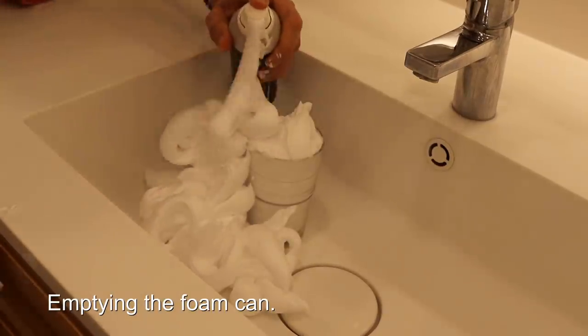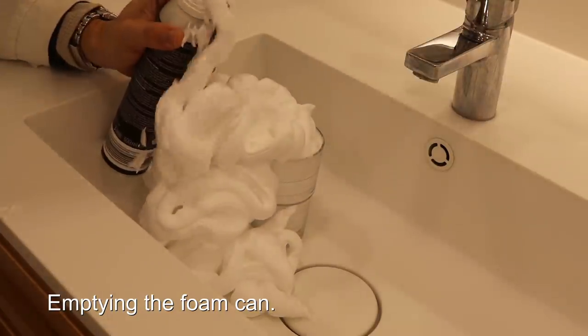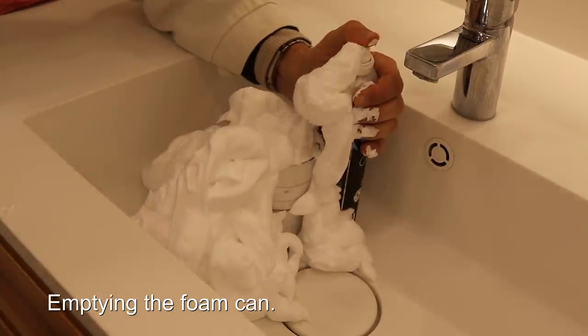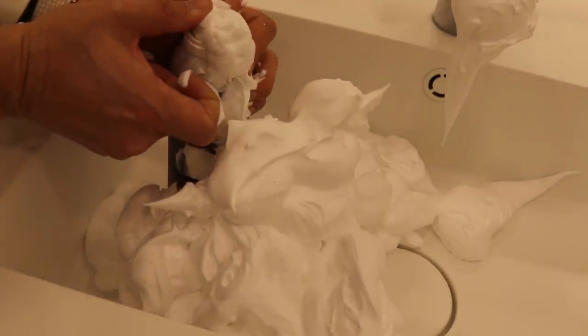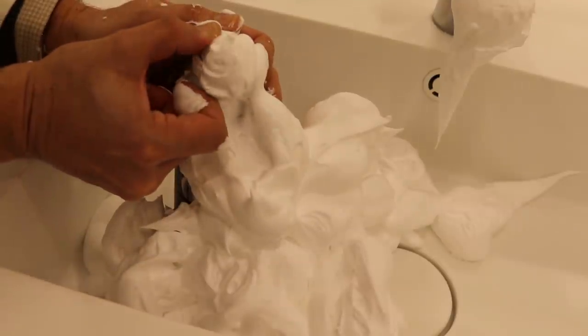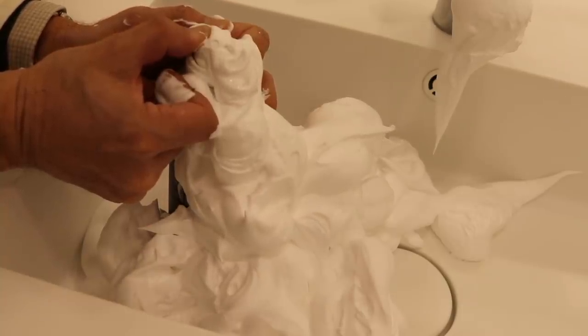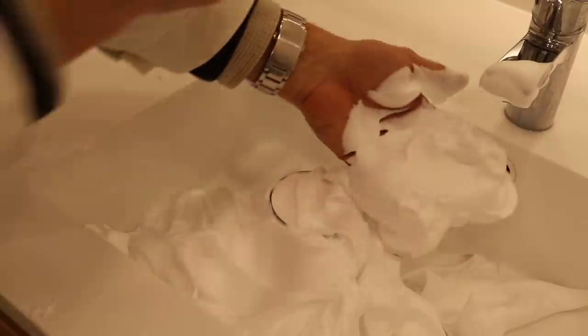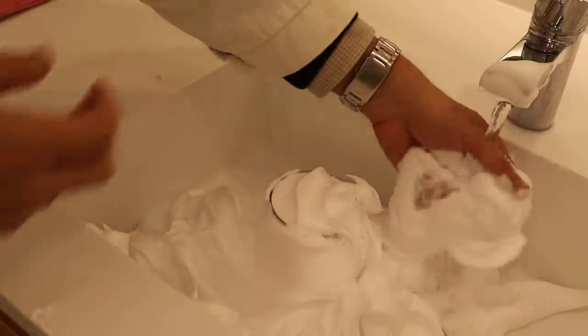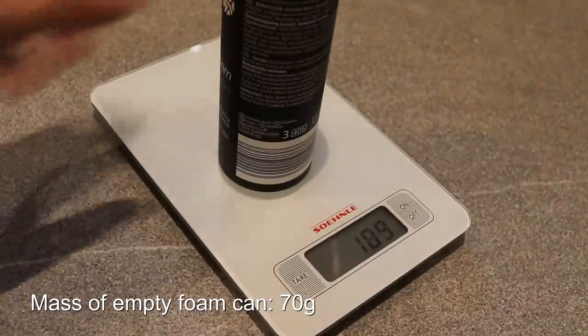And now I have to empty the foam can. So that's quite something right now. It actually shows you how much foam there is in one can. A little bit of time lapse again, because otherwise we have to wait too long. And now basically the can is pretty much empty. That's a lot of foam. The empty can, 70 grams.